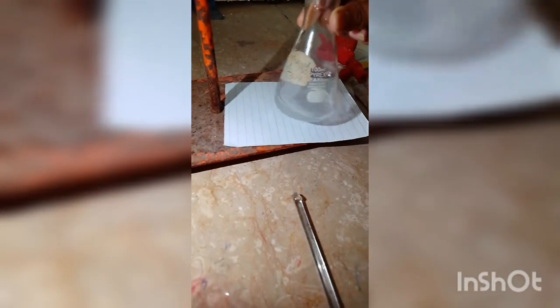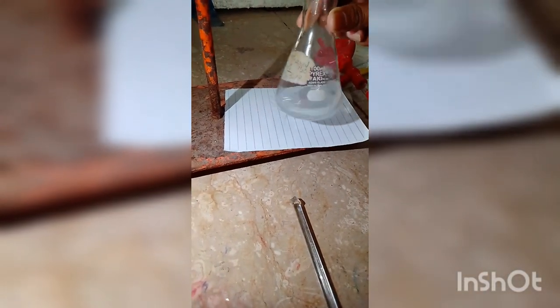To avoid a sudden color change and get a better result, keep your eyes on your solution. When you get the color change, take three consecutive readings and find out the volume. Using the dilution formula M1V1, you will get the molarity.